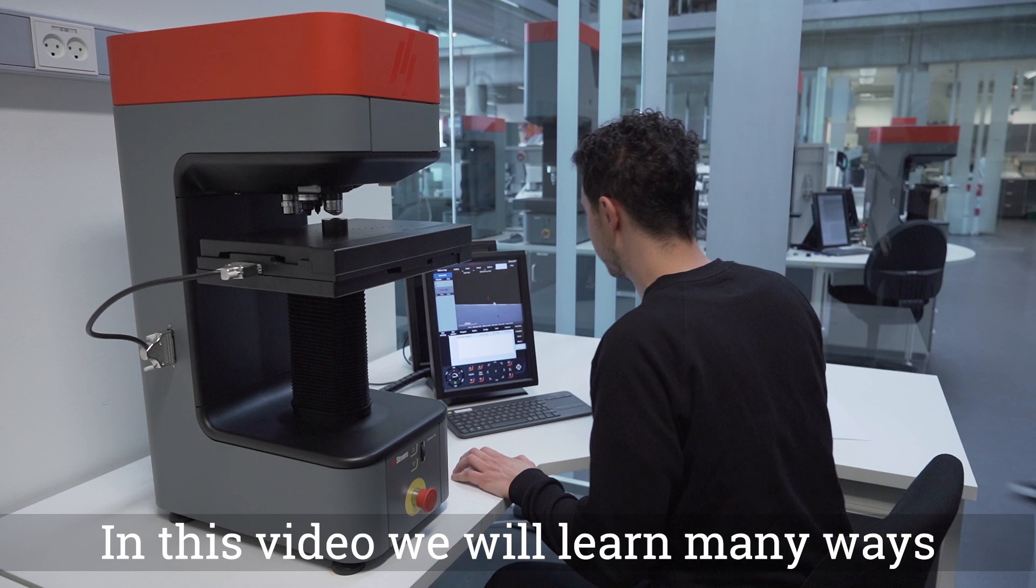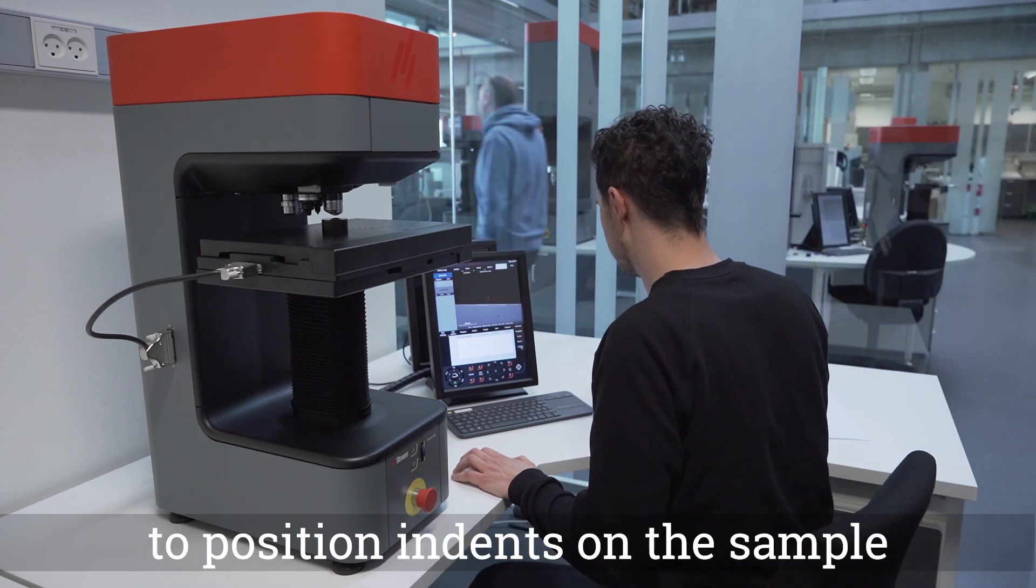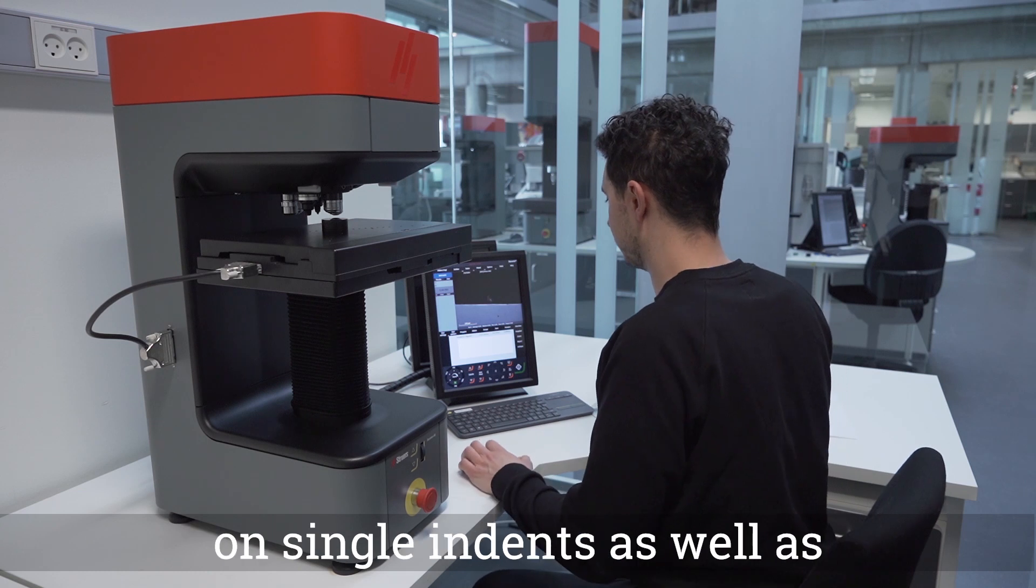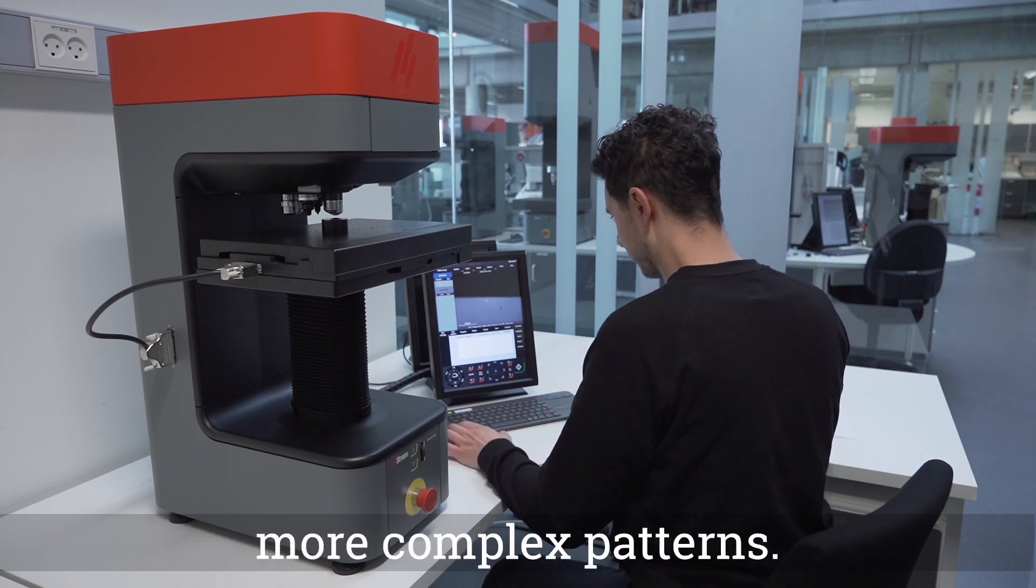In this video we will learn many ways to position indents on the sample we want to test. These methods can be used on single indents as well as more complex patterns.